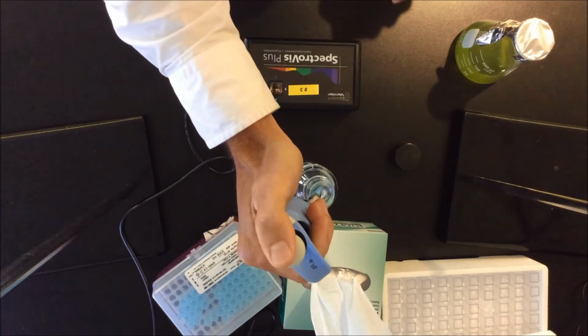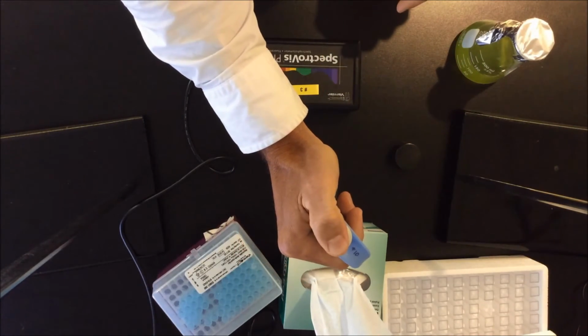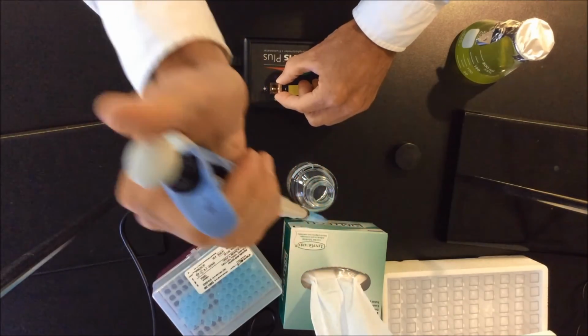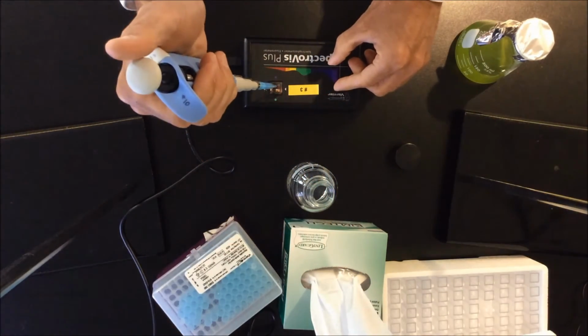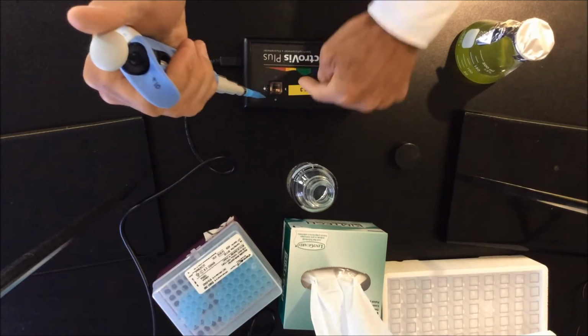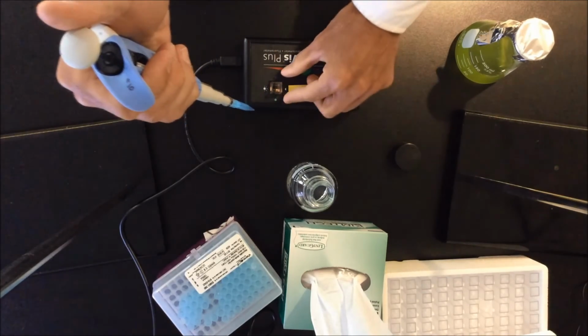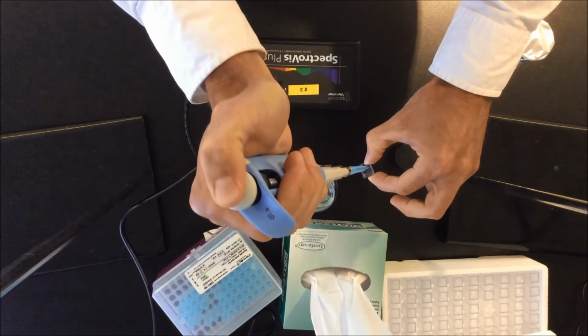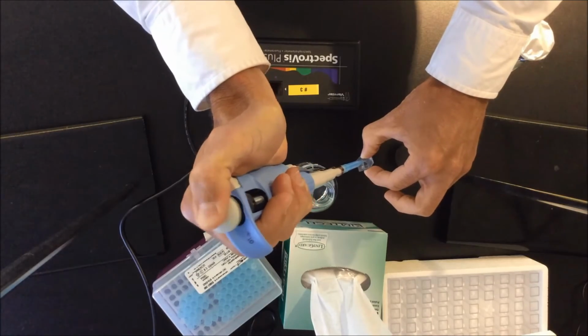Now remember, you press down at the first stop, you stop, and you take in the liquid. Now, do not, I'm telling you, do not fill your cuvette like this. If there's water or growing medium going around and inside, you're going to ruin the lamp and ruin the device. So take it on the side, and then you can press up to the very bottom here.